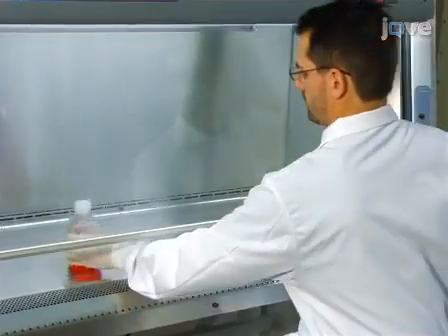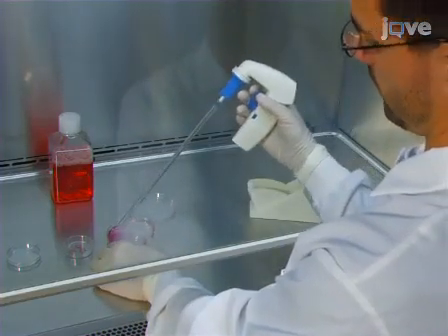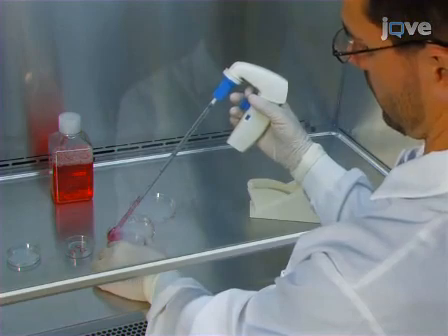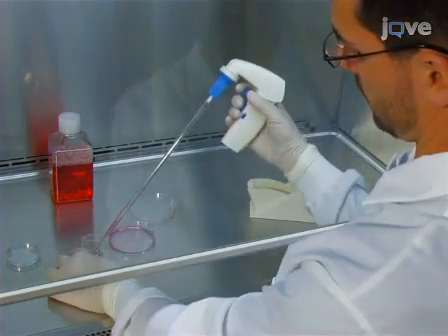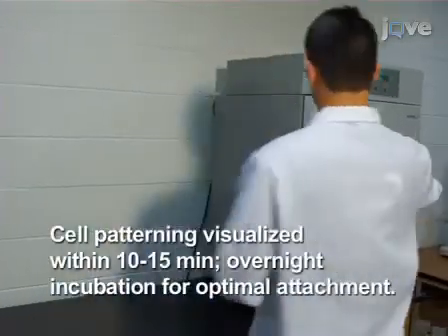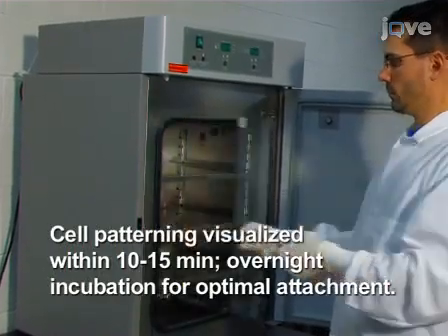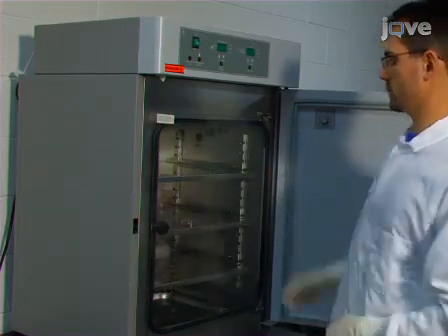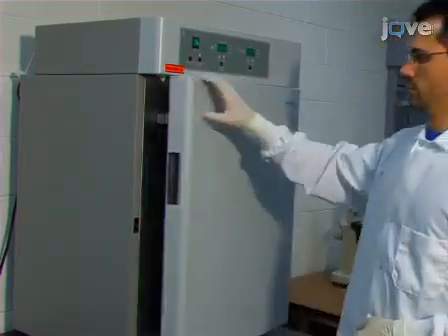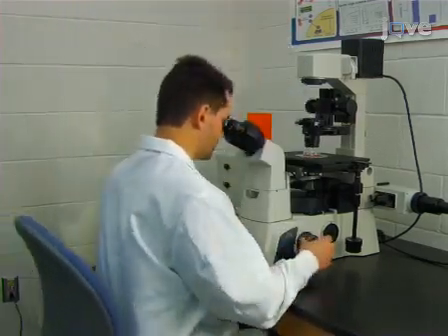Dilute the experimental cells of choice in their standard culture media to achieve the desired confluence when placed onto the patterned petri dish surface. Pour 3 milliliters of the cell solution into the petri dish. Incubate the patterned petri dish at 37 degrees Celsius, 5% carbon dioxide, 100% humidity for several hours to several days to allow the cells to assemble onto the pattern created by the plasma. Cell patterning is checked with phase contrast microscopy.